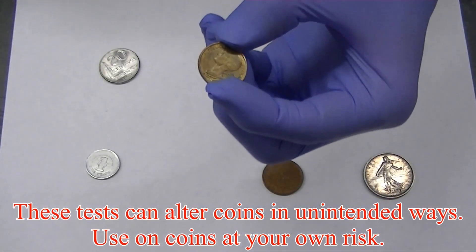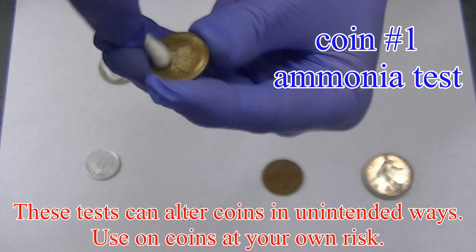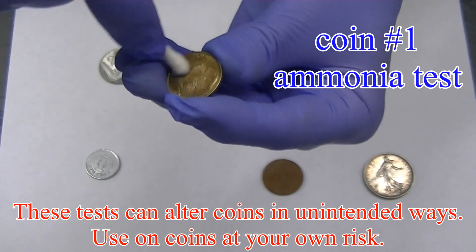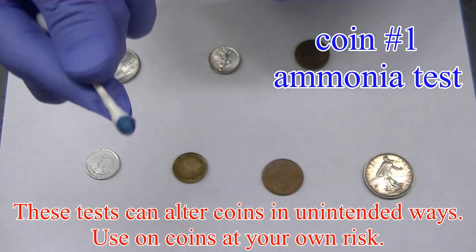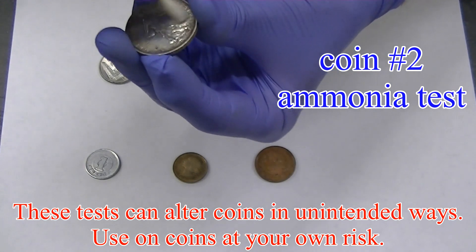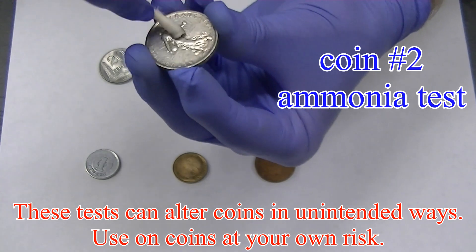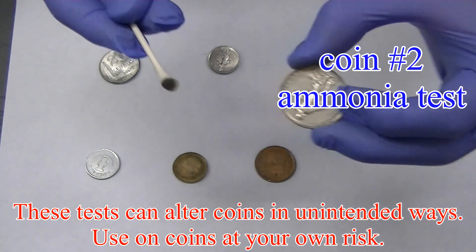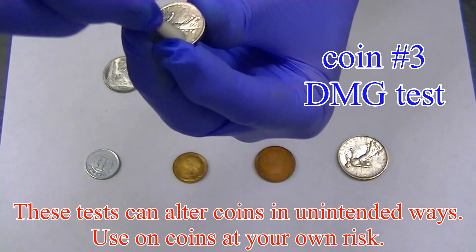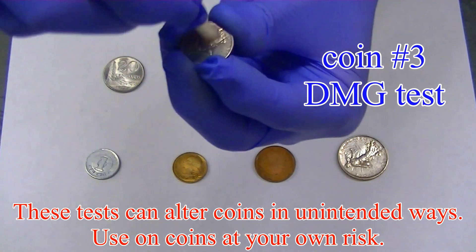To conclude, I'm going to try some of these tests on various coins. See if you can tell what metals are present on the basis of the tests that I do. I'm applying the ammonia test and the DMG test to each coin. Be sure to let me know in the comments what metals you think are present in each coin — I look forward to hearing from you.